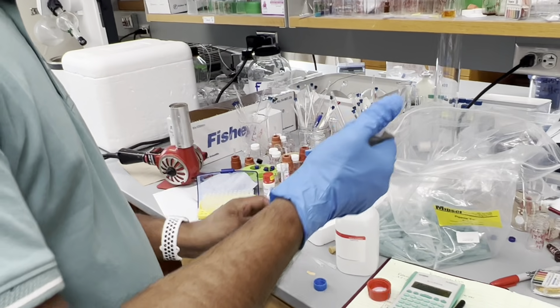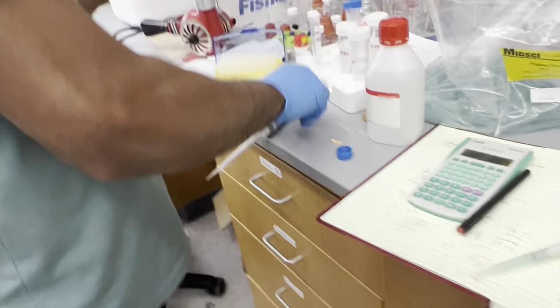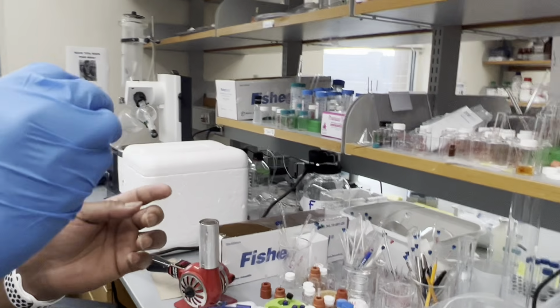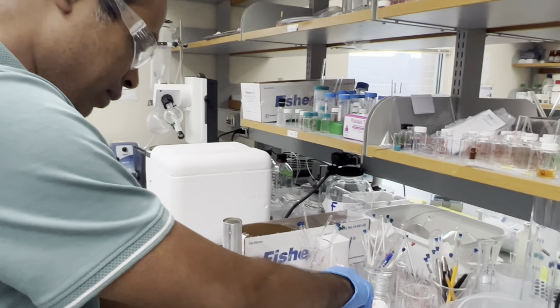Did you understand the part, what I am doing exactly? You just readjusted, right? To ensure that it'll still be 5% DMSO in the end. Yes. Actually, what are you doing at the moment? That's the DMSO. So basically, how much DMSO we need to add? Total was 490, right? But since we have added 30 microliter of the HCl, initially I thought 30 microliter HCl and 460 microliter of the DMSO, so that will be 490 microliter of the volume, right?